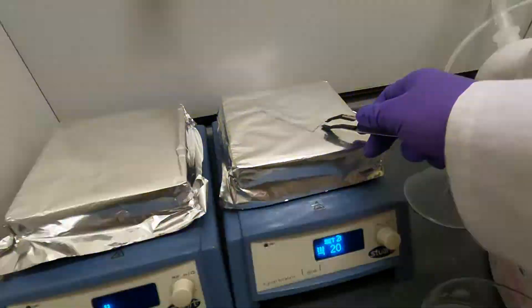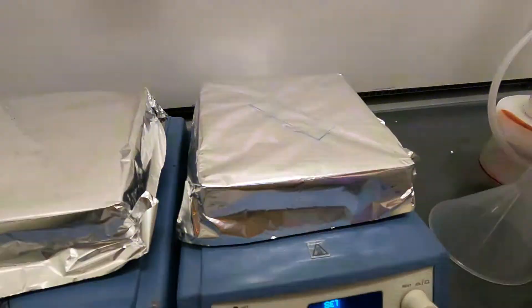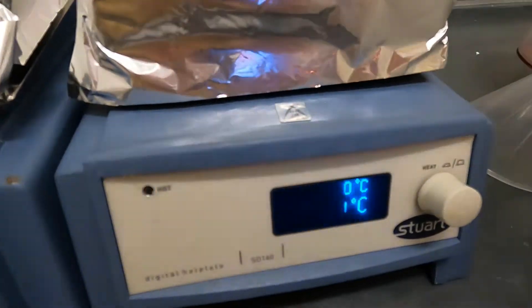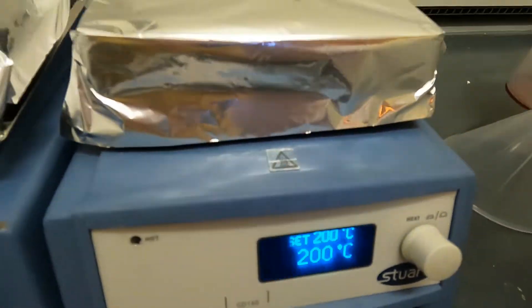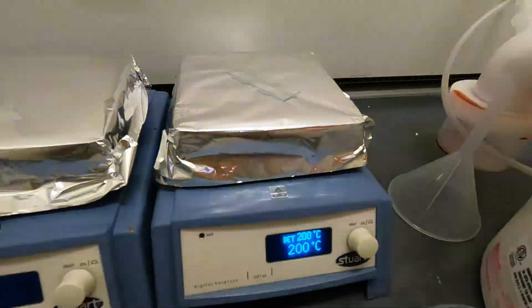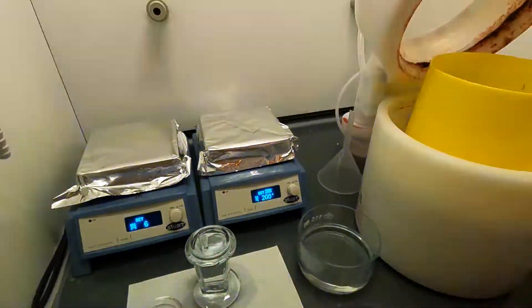We put it on to a hot plate at 200 degrees for about 10 minutes. I'm going to start the timer now and we leave it there for 10 minutes. This is called a water desorption step.